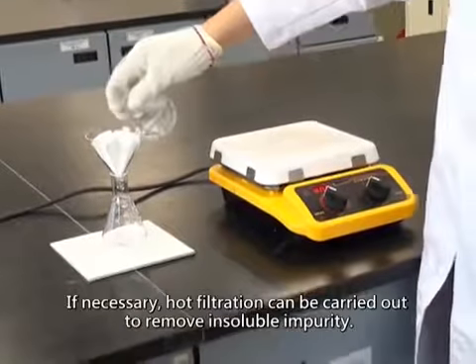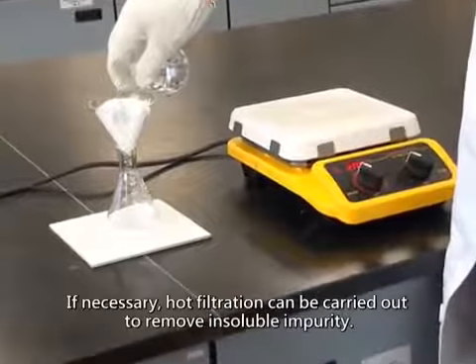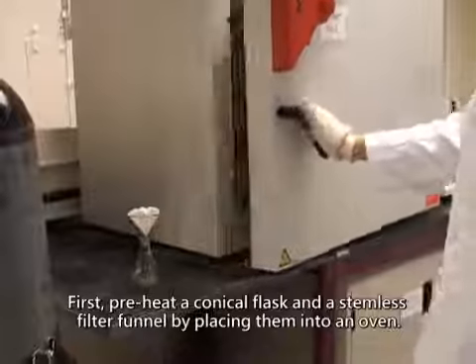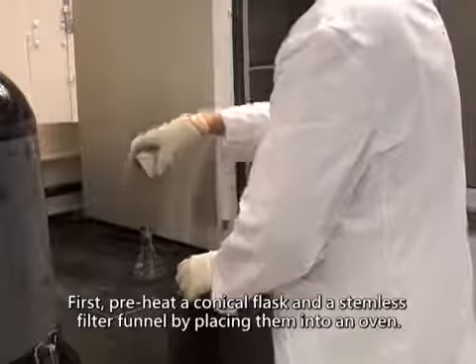If necessary, hot filtration can be carried out to remove insoluble impurity. First, preheat a conical flask and a stemless filter funnel by placing them into an oven.